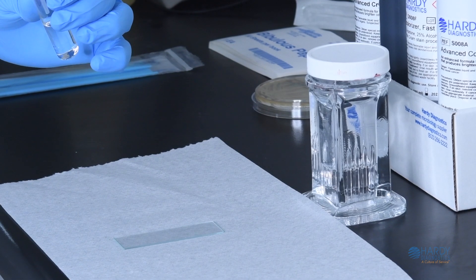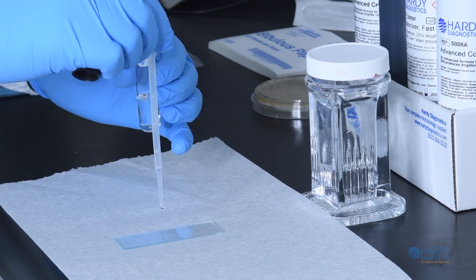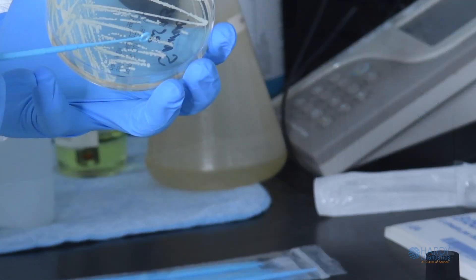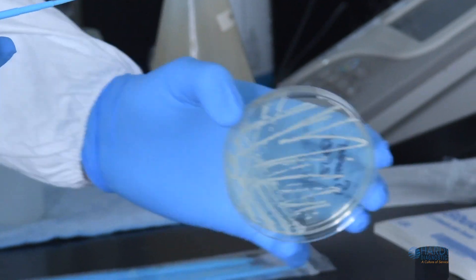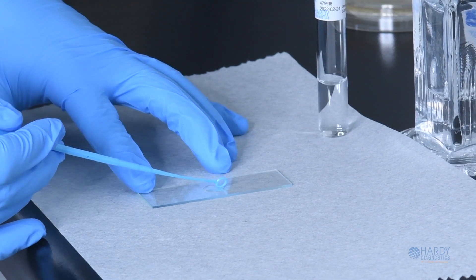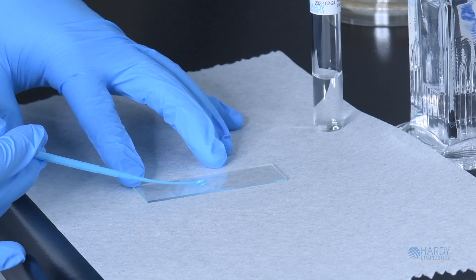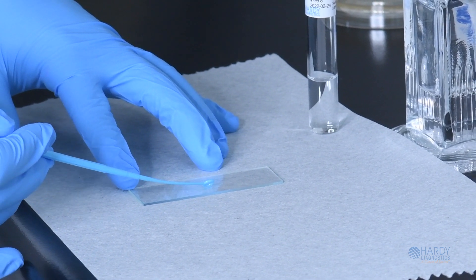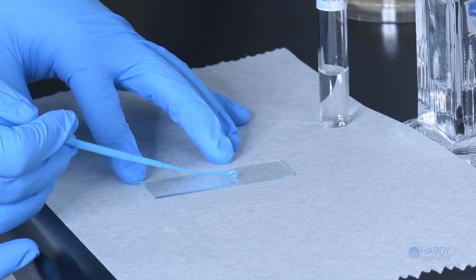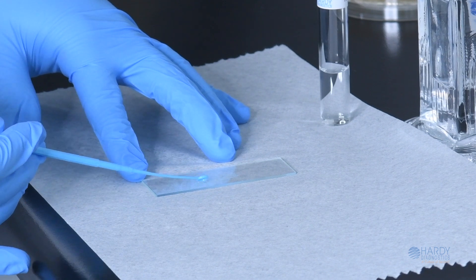The Gram stain begins by adding one drop of sterile saline or deionized water onto the center of the slide. Then take a sterile loop and touch the edge of an isolated colony on the petri plate. Place the loop into the drop on the slide and swirl it around to distribute the cells evenly so the cells are one layer thick. Using cells from a single colony is important, as this should represent only one cell type rather than a mixture of cells.